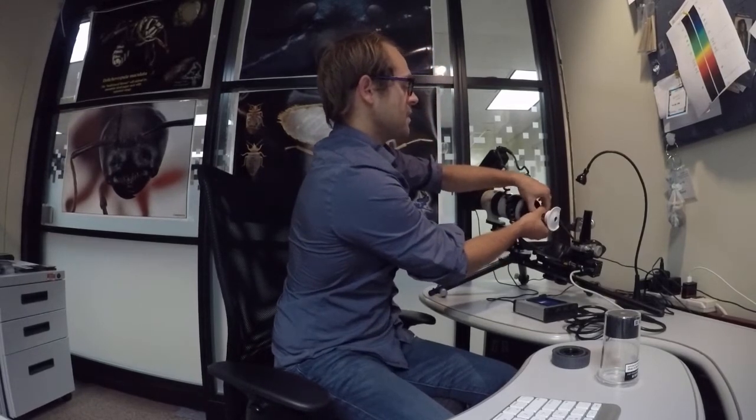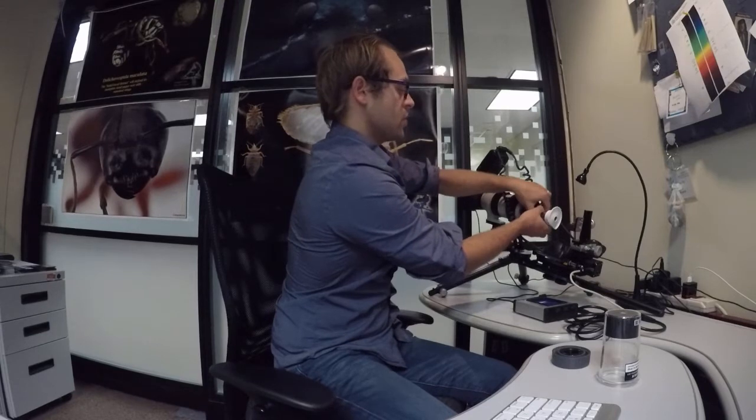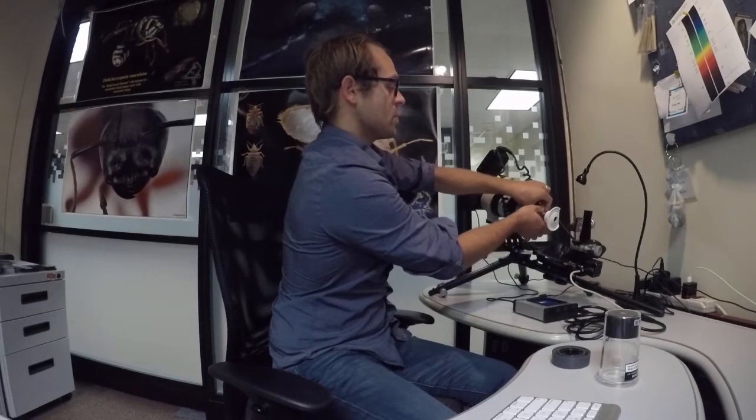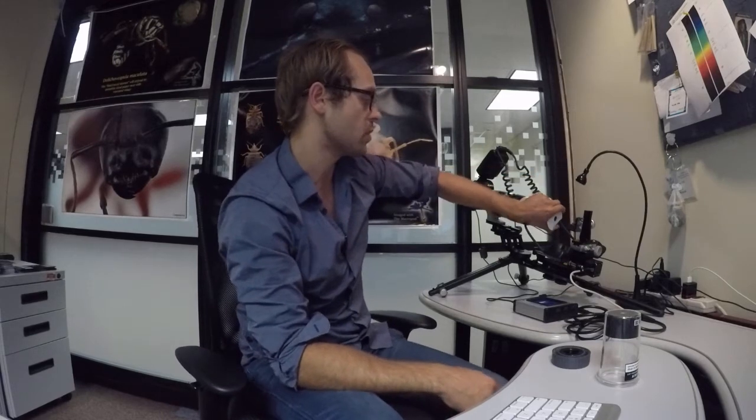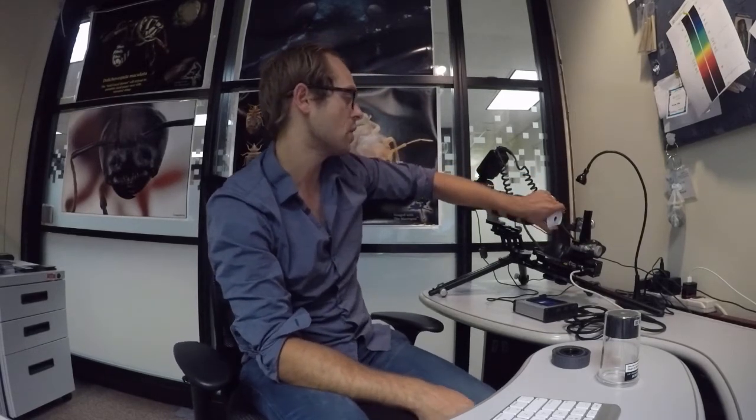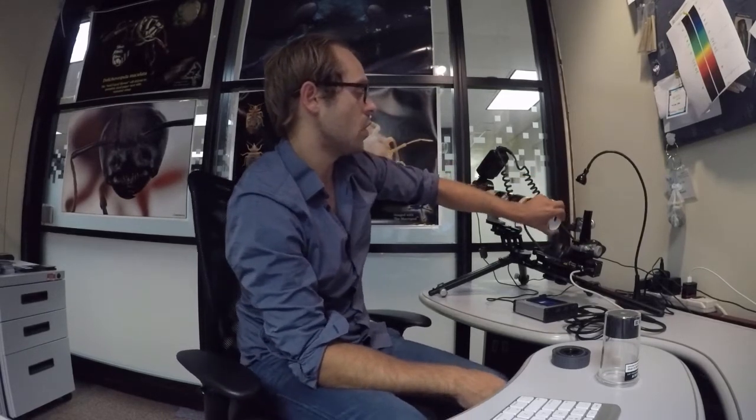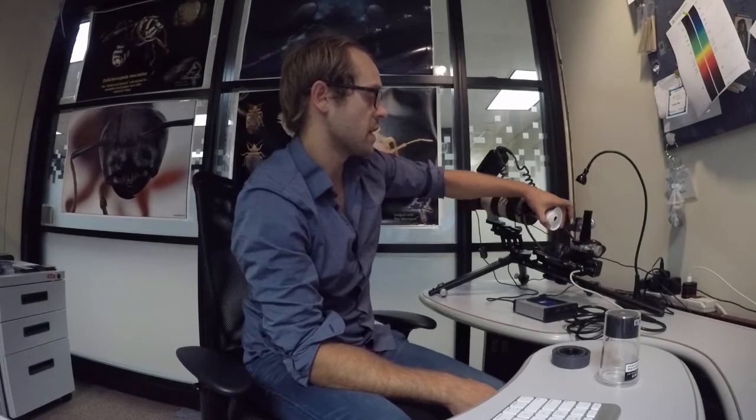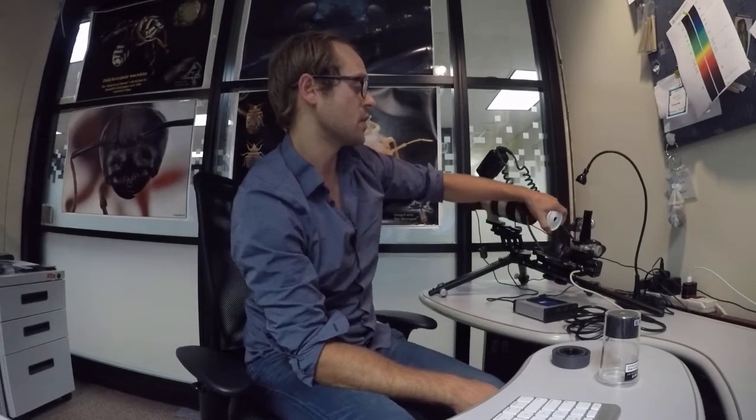Now lens settings are exactly the same, they don't change. So 200mm, you'll have your button set to 1.2mm or 1.2 meter working distance as opposed to the 2.4. All the ultrasonic motors must be turned off, and you're going to be using manual focus.